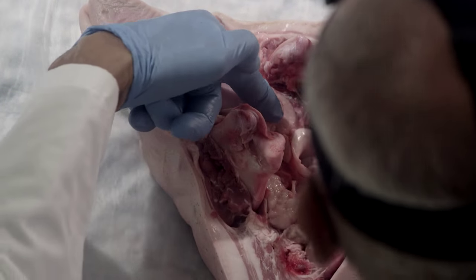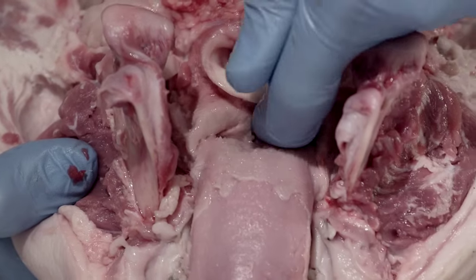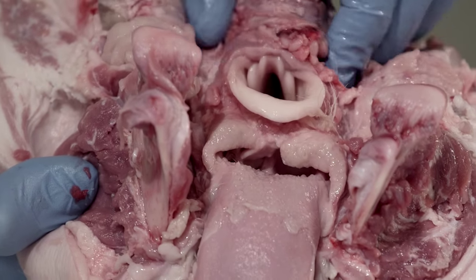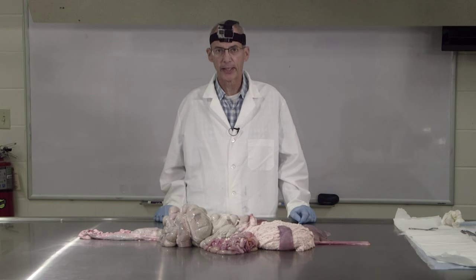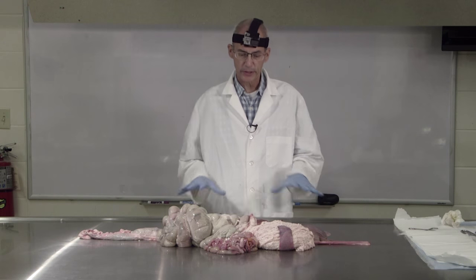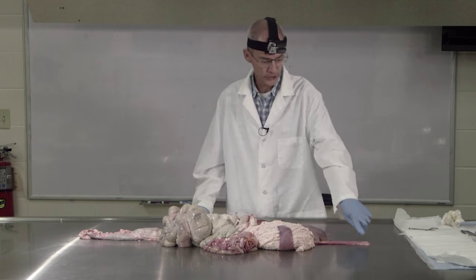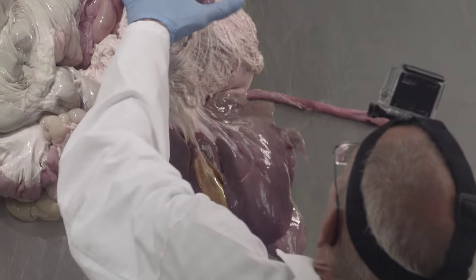After the food material has been chewed, it will move down. Here's the tongue, and the esophagus is right back here. This is the opening of the larynx into the respiratory tract, which sits just above the esophagus. So we've looked at the mouth as the first part of the digestive tract in the pig. Now we're going to move on to the rest of the digestive tract. What we've tried to do is lay the tract out roughly the way it would be situated in the animal.